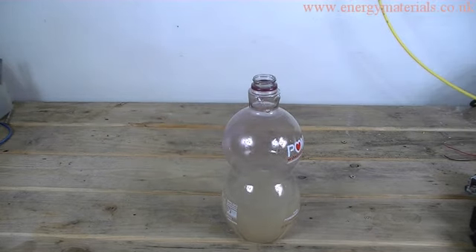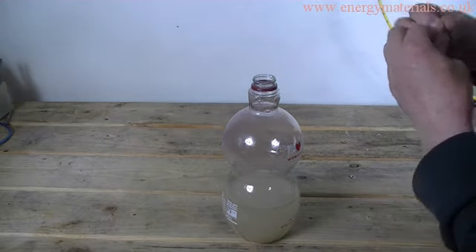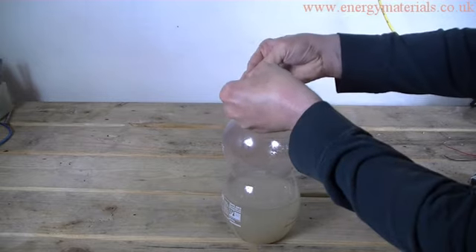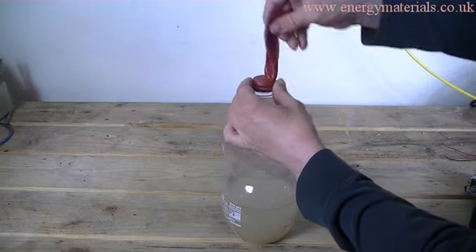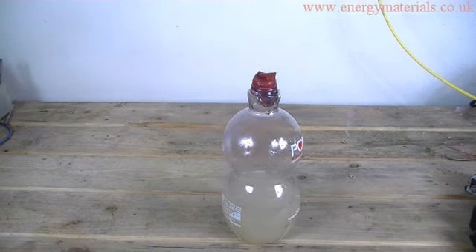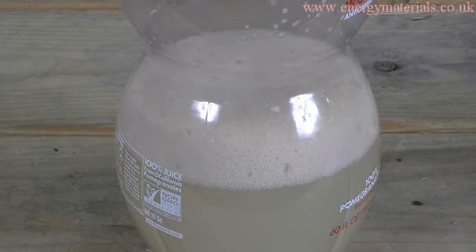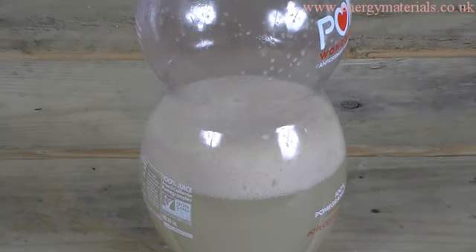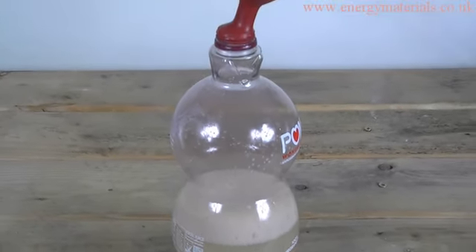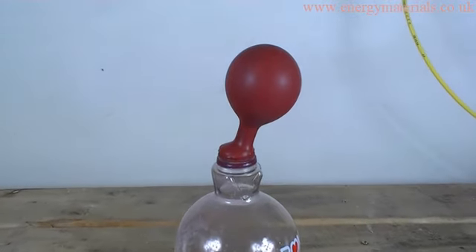We attach a balloon to the top of the bottle to catch any gas which is generated. After about 15 minutes, the solution starts to froth up and a gas is generated. As we can see, the balloon is starting to inflate.